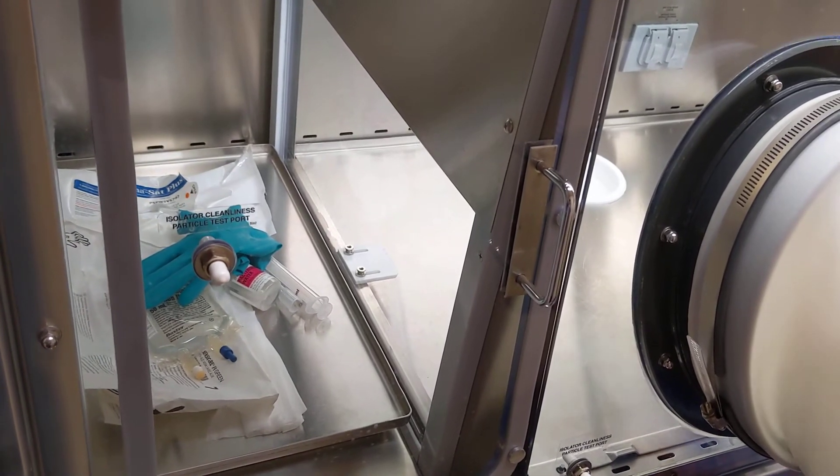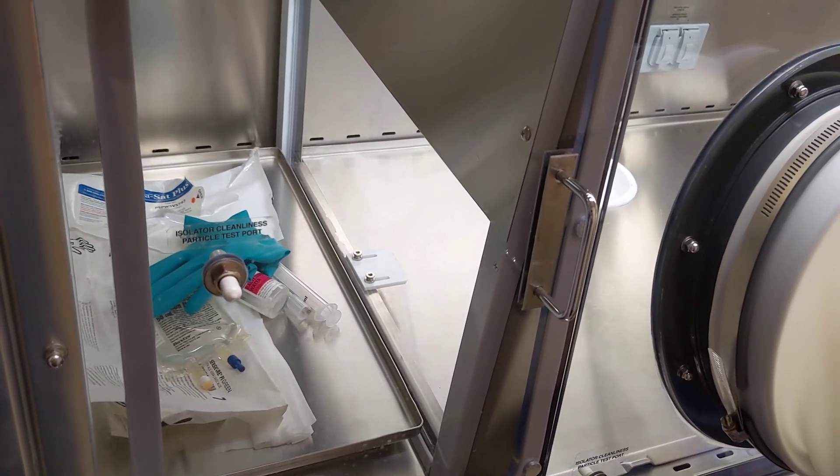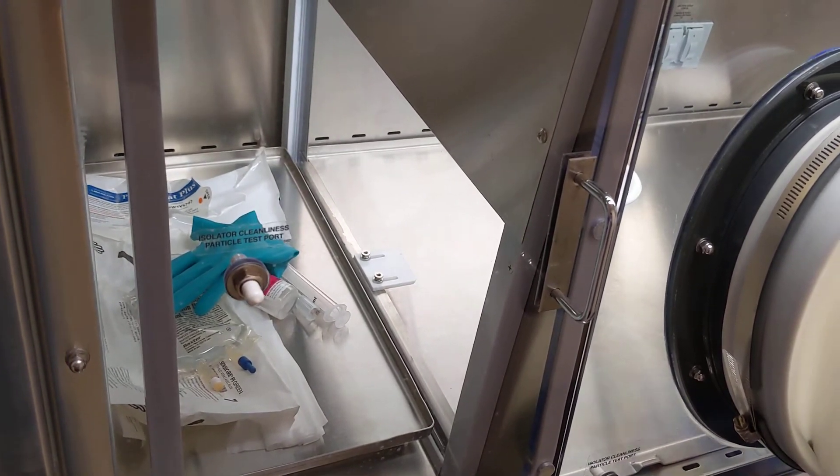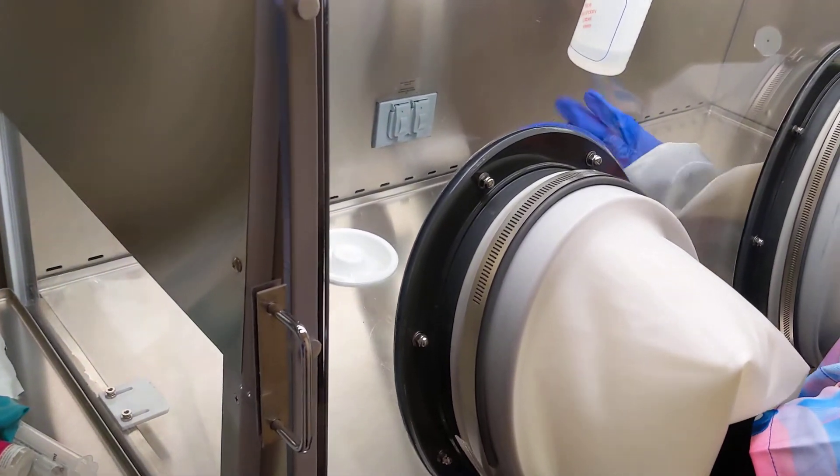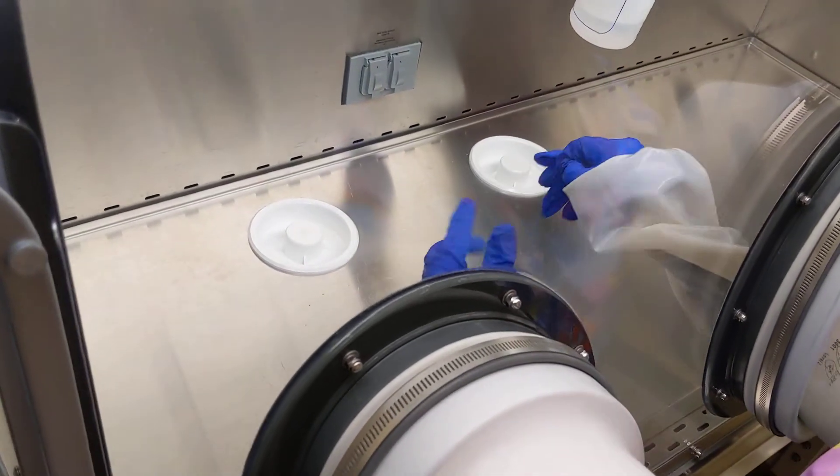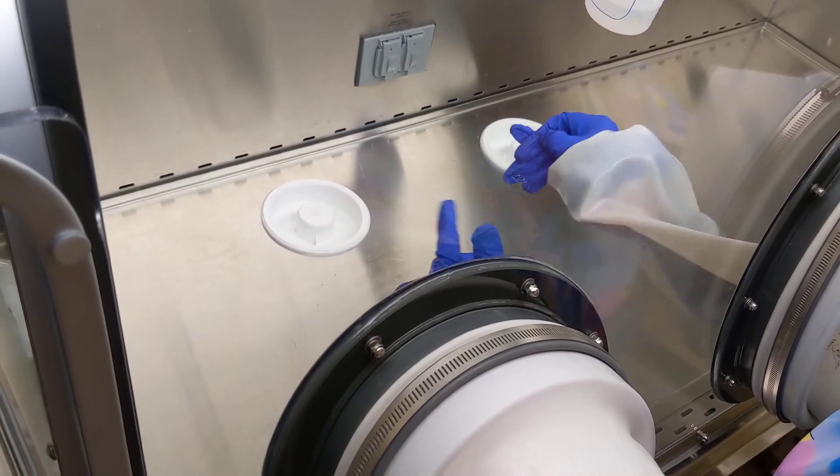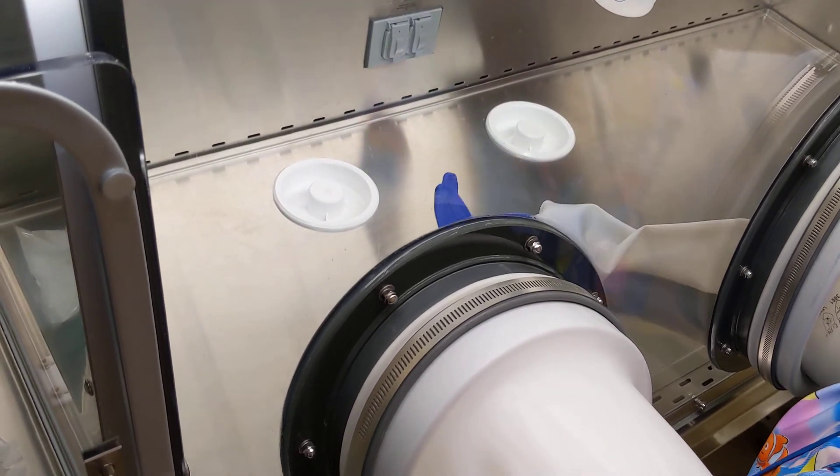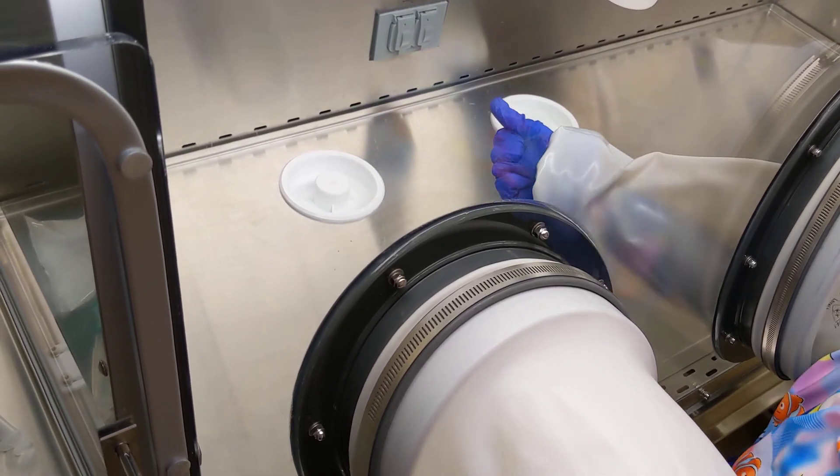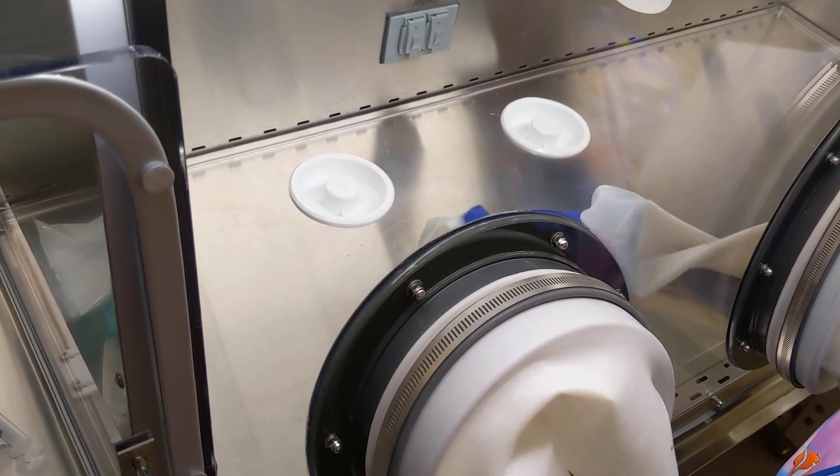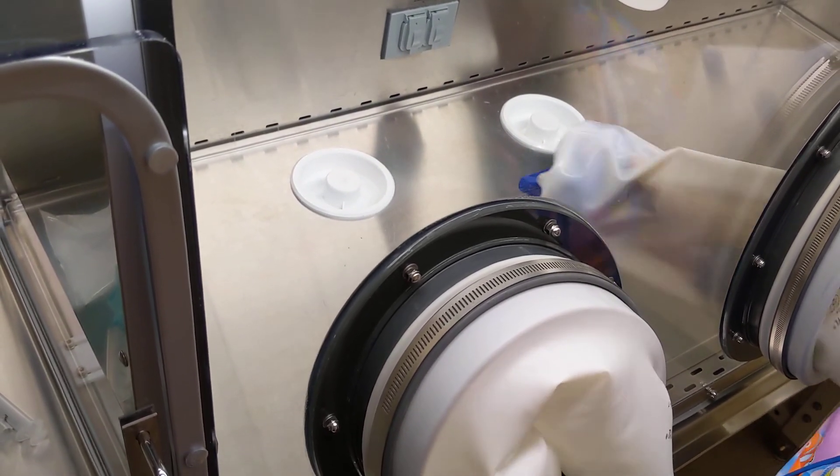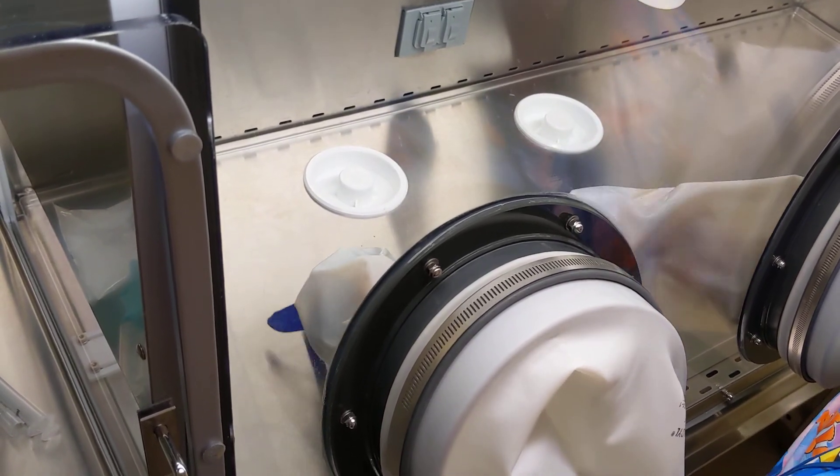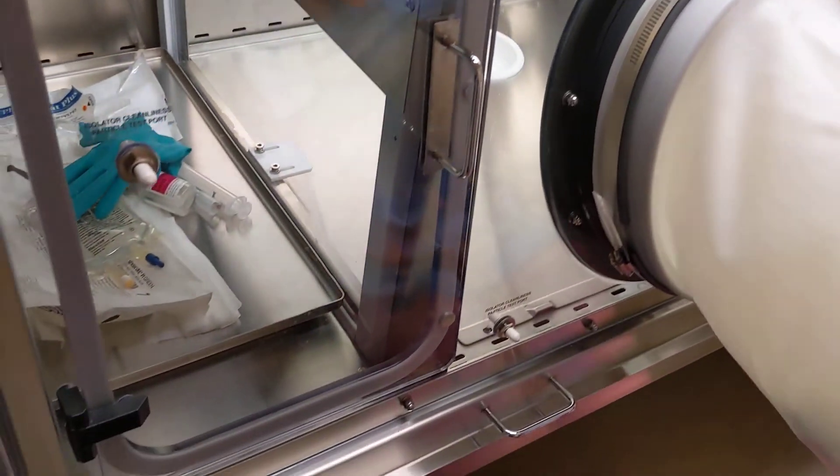Because I have gloves on underneath, I've got to try to get myself out of these ones. It's a little bit of work to get out, but I'm trying to get the inner glove out of there. And then there you go.